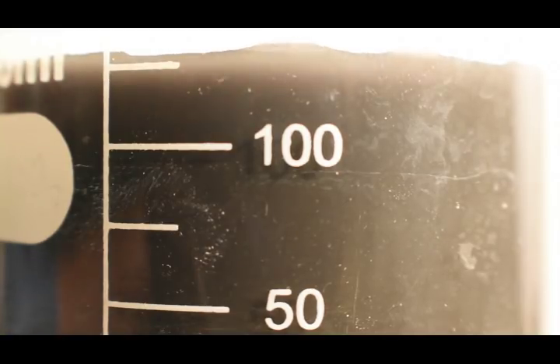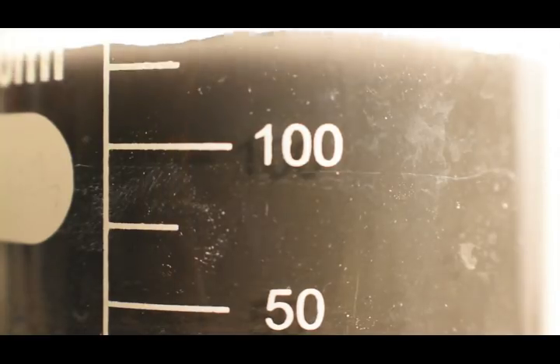Now, as we can see, there is a fair precipitate of black silver peroxide formed.